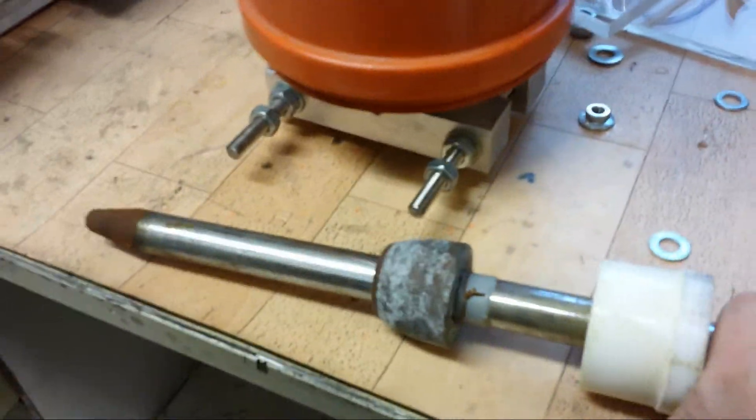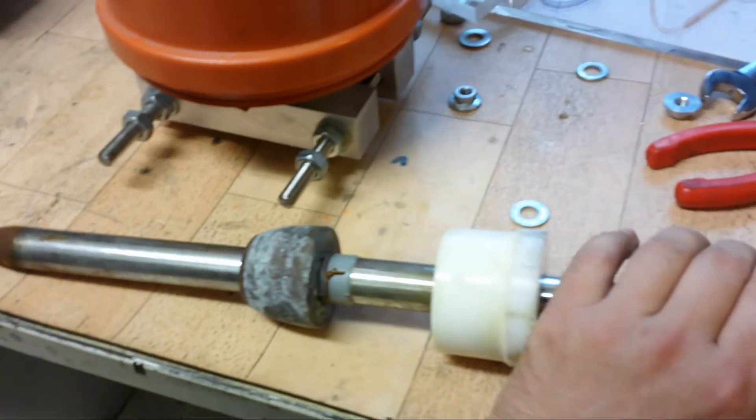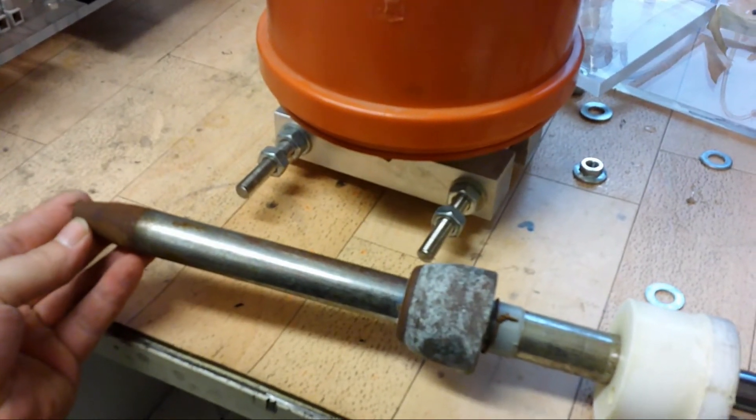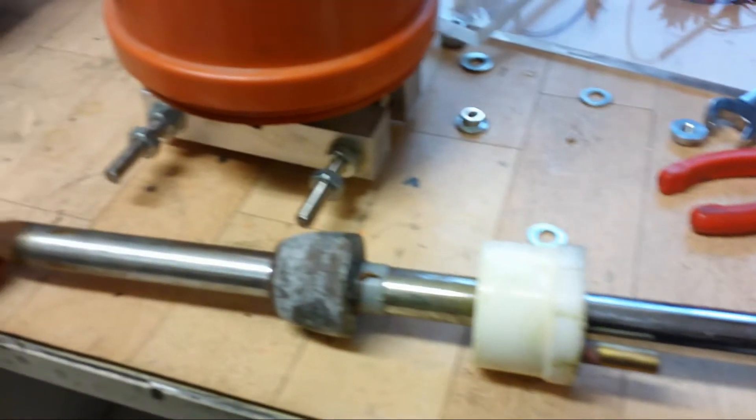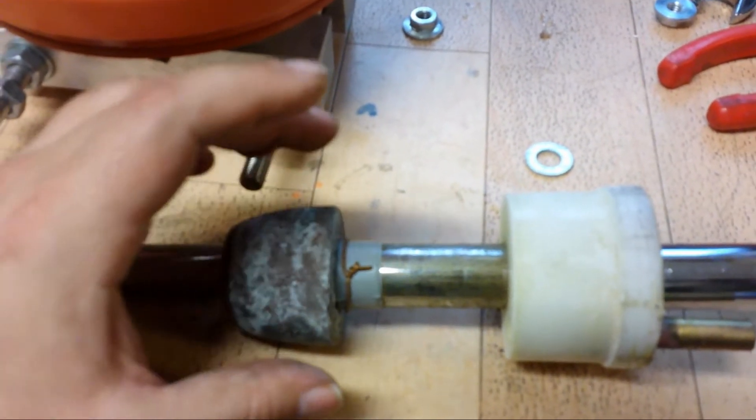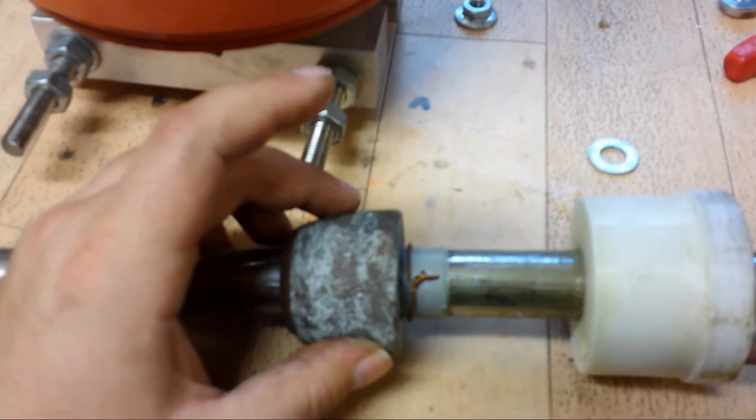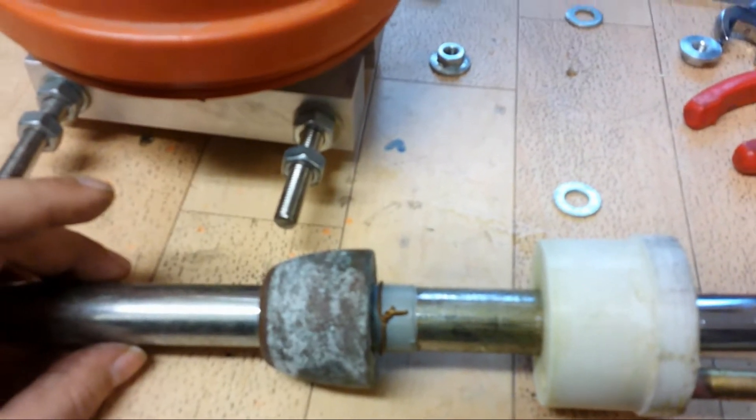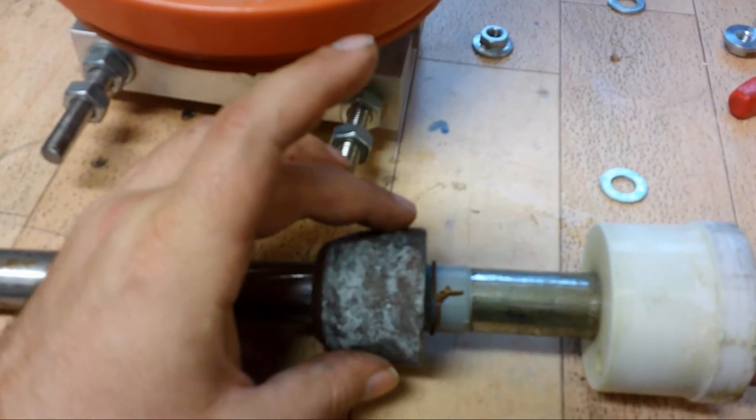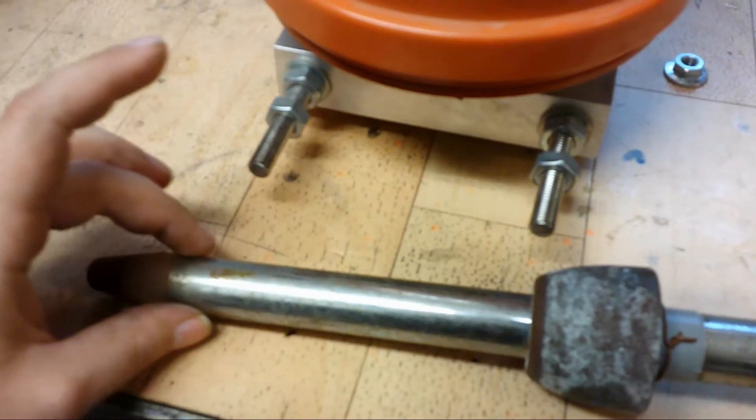Here is finally the inner electrode. I have made it from common steel, so I will replace this inner electrode with stainless steel. This part was actually made so the arc can be initialized here, and due to the heat the arc is going up here.